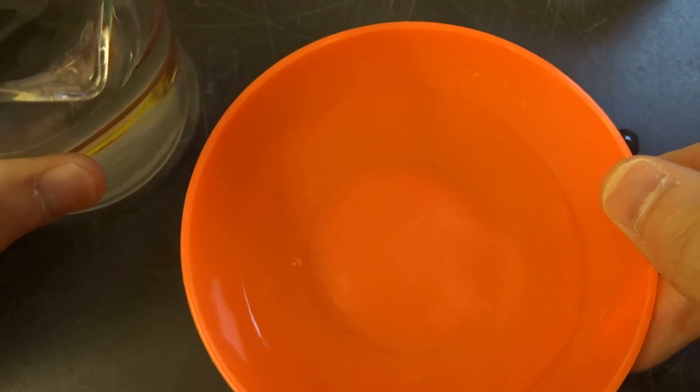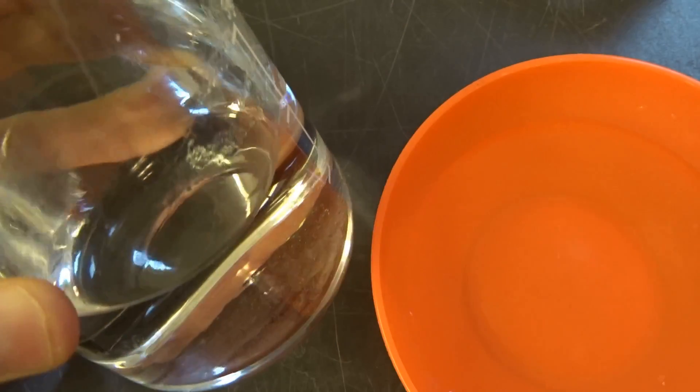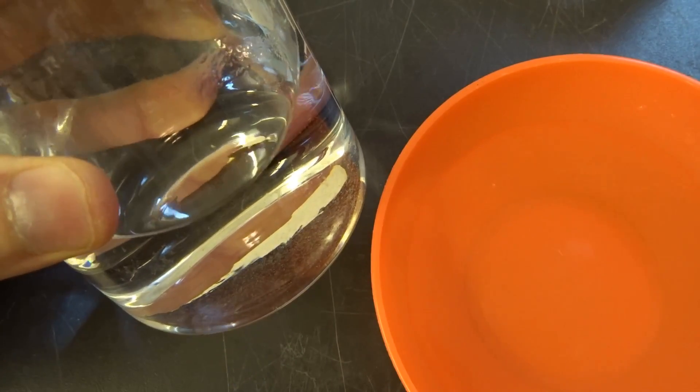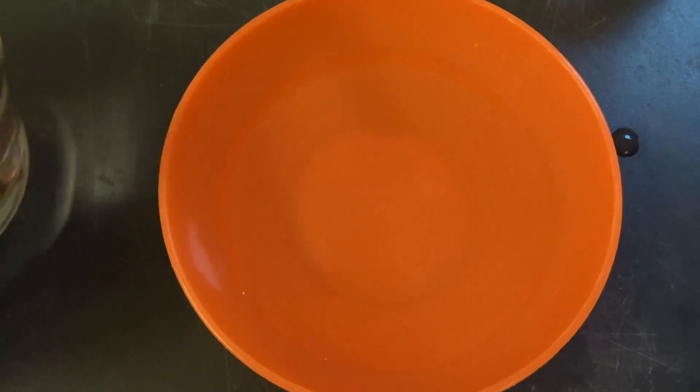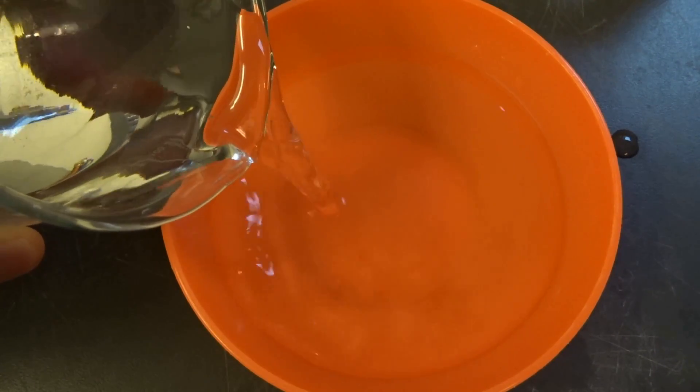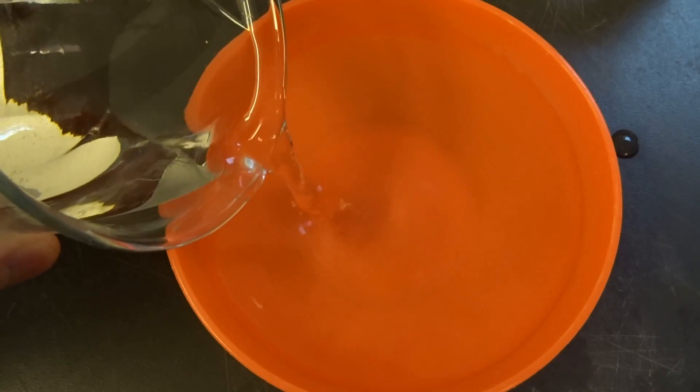And then you're going to add some acid. So I'm using sulfuric here, it was just laying around, but you can also use hydrochloric or whatever you want basically. Probably acetic works as well, so vinegar.